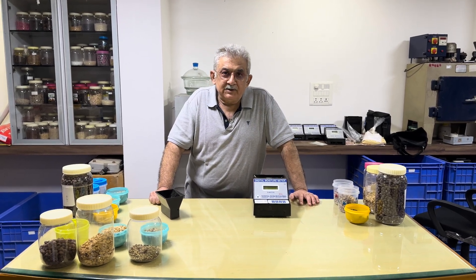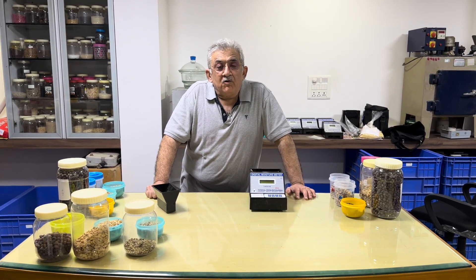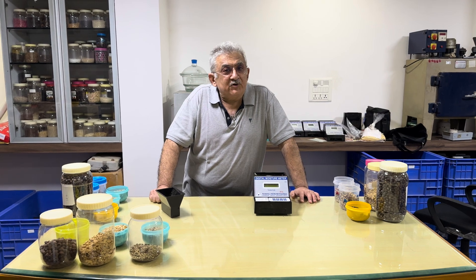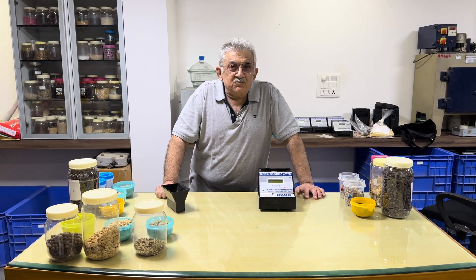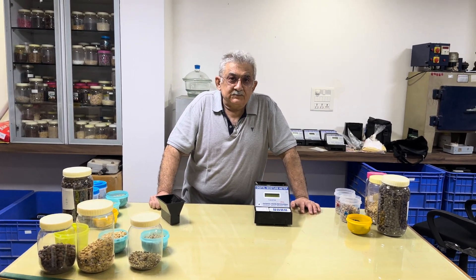National Instrument India. Today we will explain and demonstrate 3 forms of coffee.